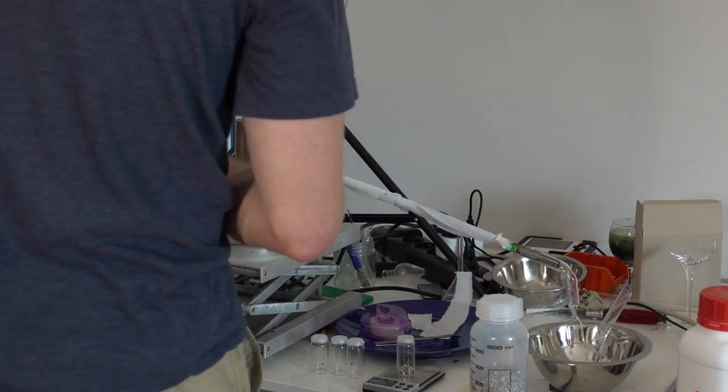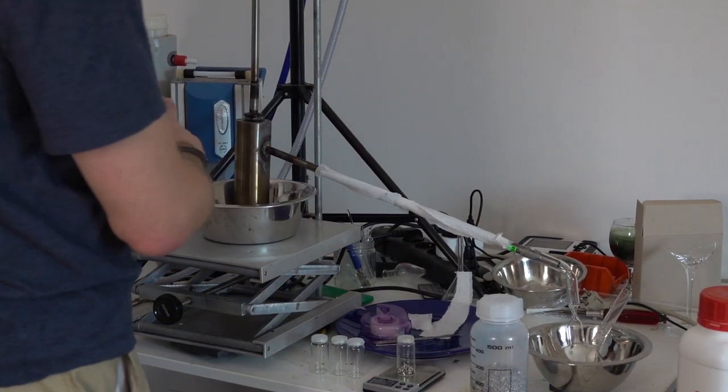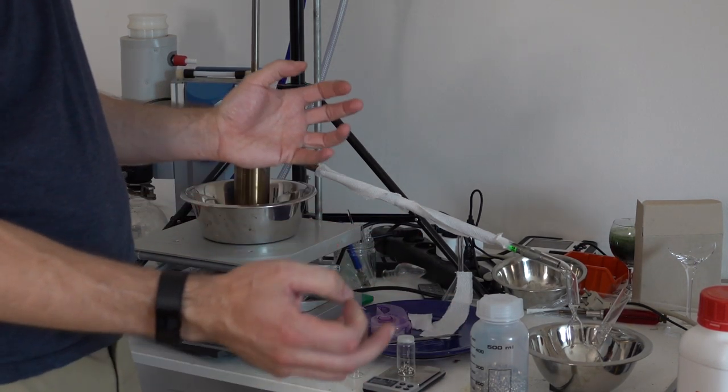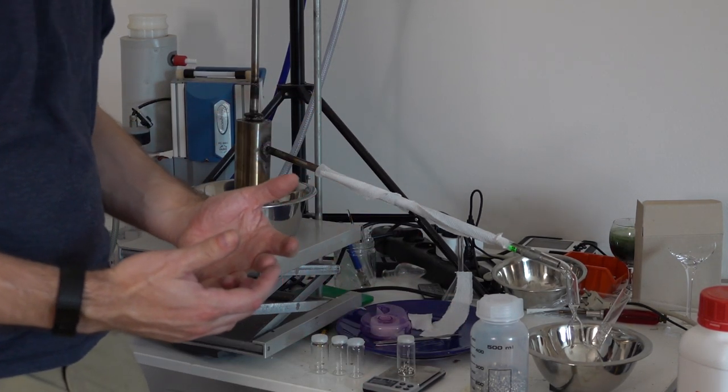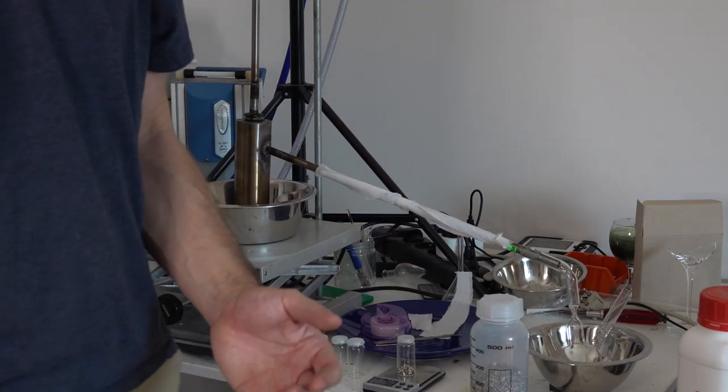Good. So the kit is now all set up. And the name of the game, whenever you're doing anything like this, but you're not entirely sure what's going to happen, is plan for, wait, what's the worst thing that can go wrong?